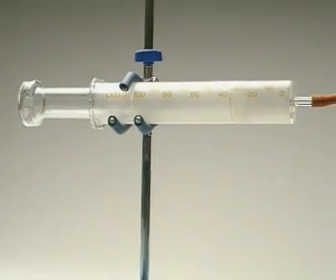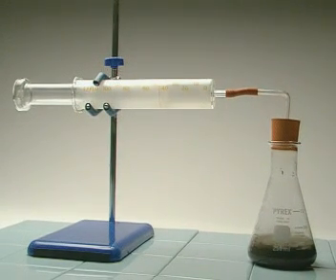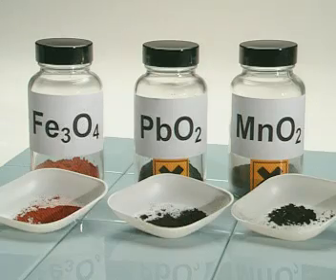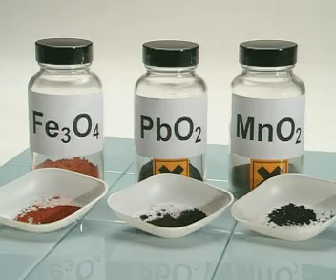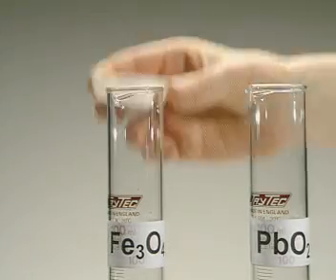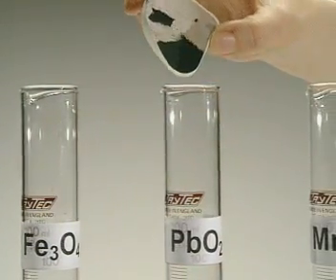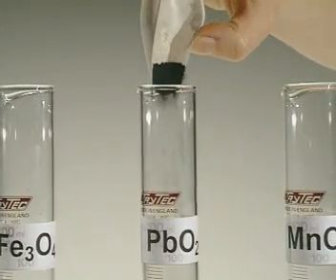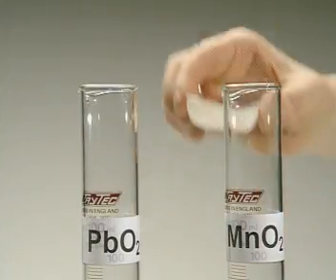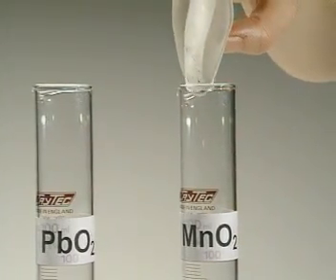But is it the best catalyst for the job? To find out which of these catalysts speeds up the decomposition of hydrogen peroxide most effectively, the same mass of each is placed into a measuring cylinder: iron oxide, lead dioxide, and manganese dioxide are the chemicals under investigation.